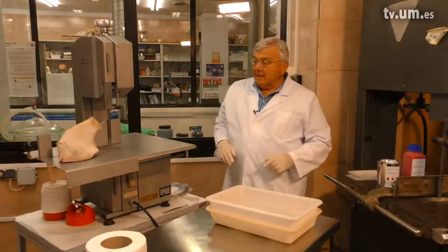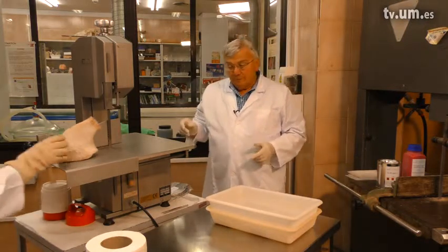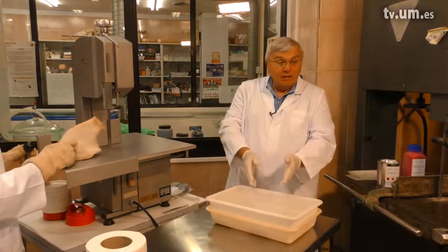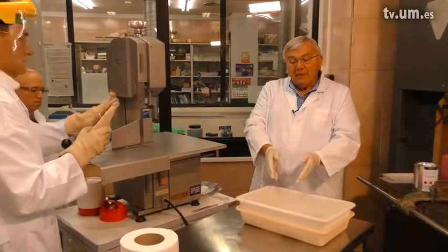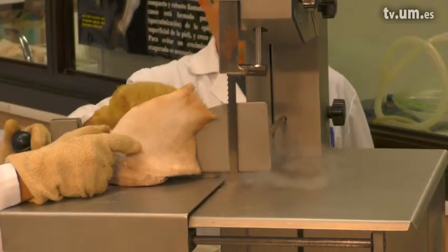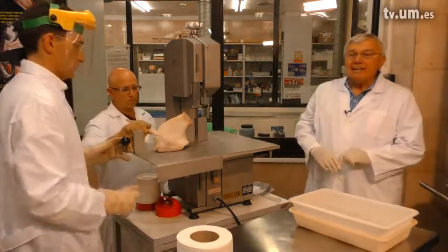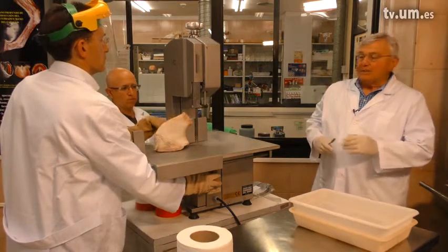Slicing will be about three millimeters, which makes a nice slice. We'll take the slice, and once it's sliced, put it in cold acetone. After it's in cold acetone, we'll clean it — take a scalpel and scrape off the sawdust. The specimen has been frozen to minus 70°C for three or four days to ensure the best specimen.